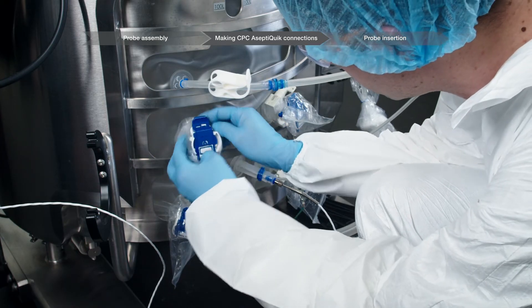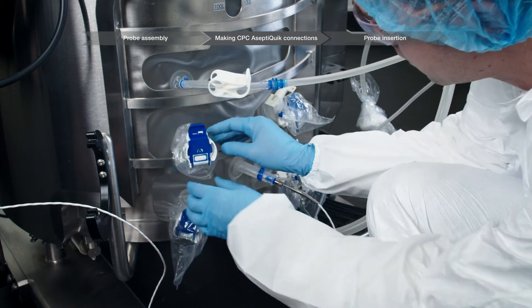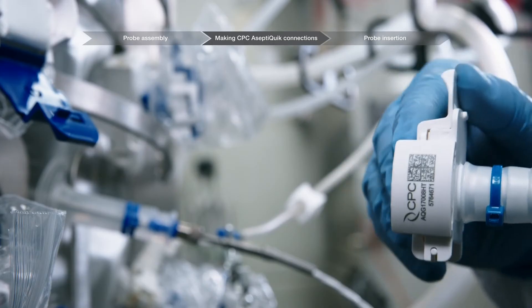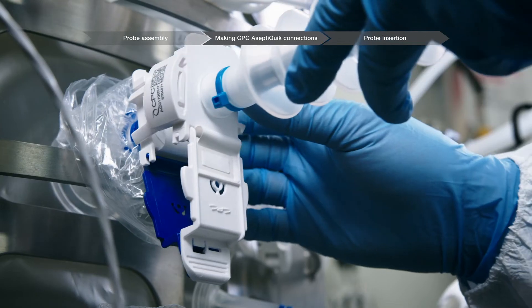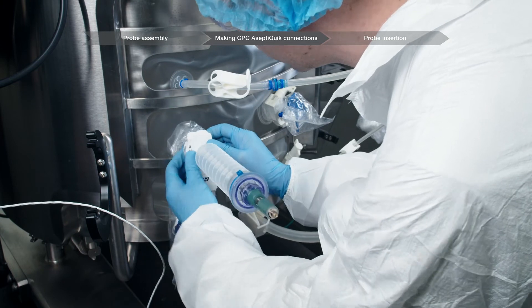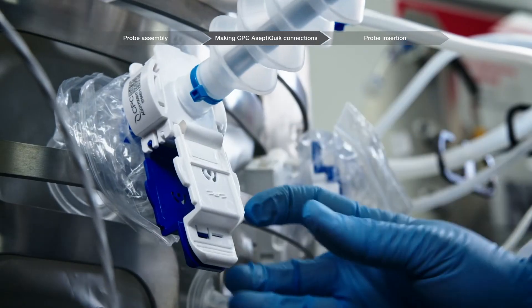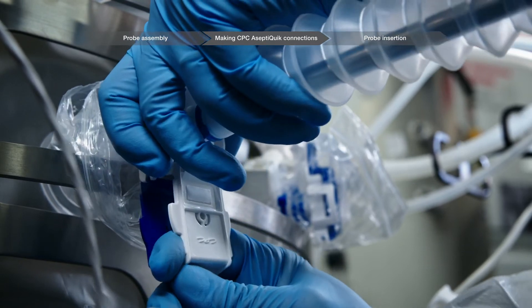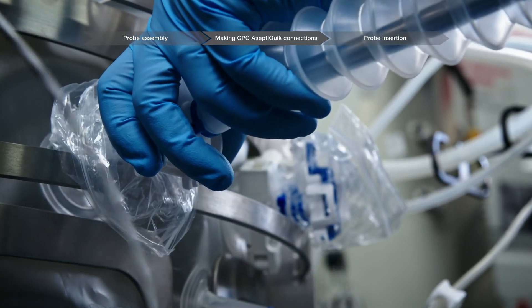Tear open and remove the plastic covering on the connector located on the BPC. Unsnap and flip open the protective cover pull tabs on both connectors. Align the two connectors and push them together. Squeeze each side of the connectors until you hear a click. Grab the joined pull tabs and pull to remove the paper membranes from the connectors. The pull tabs will also be removed.